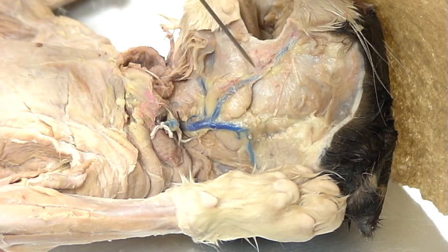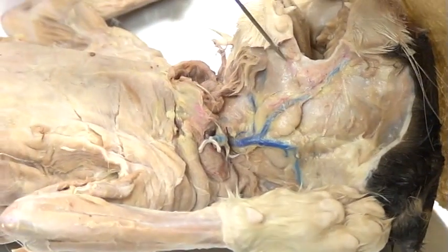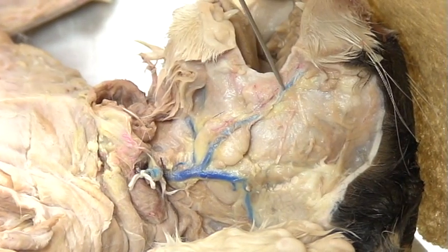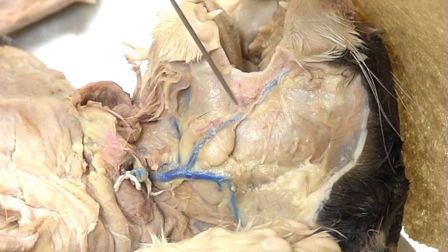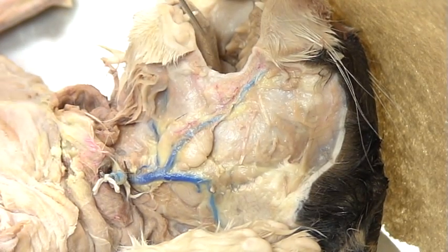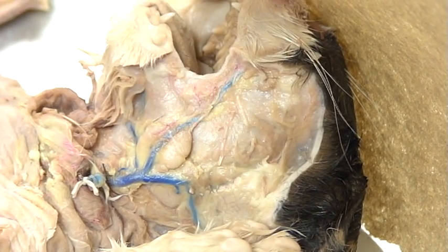There is one more gland right here at the base of the mouth, and on this cat it actually turned out pretty well. A lot of times this one is harder to see because it's so close to the skin, but you can see it pretty well here. Right here in this corner of the mouth, following the blood vessel up, this entire corner is all the molar gland — molar, like the molars of your teeth. This gland is actually a scent gland; cats are always seen rubbing the corners of their mouths against tables and walls — they're leaving their scent behind. So this is not a salivary gland, but since we're looking at all the glands, it's worth identifying. It's almost a triangular-shaped gland, and this is how they leave their scent behind.